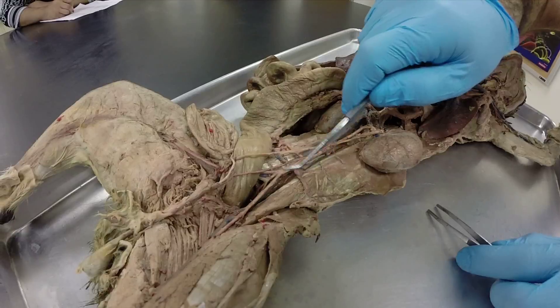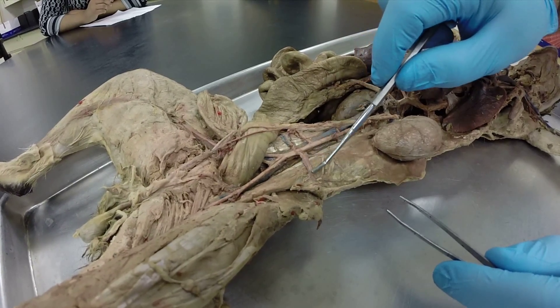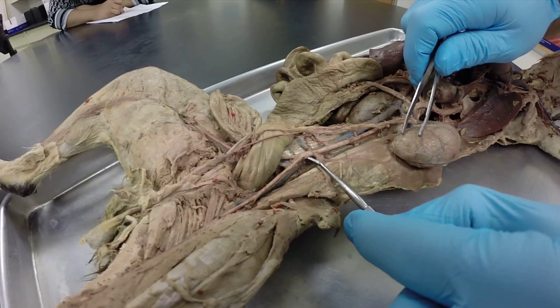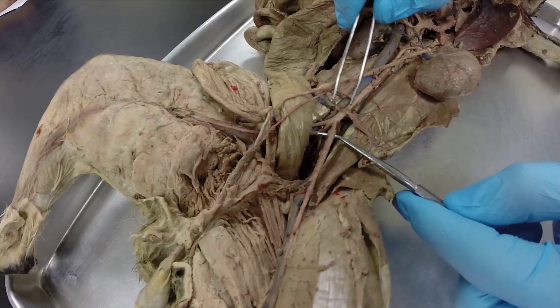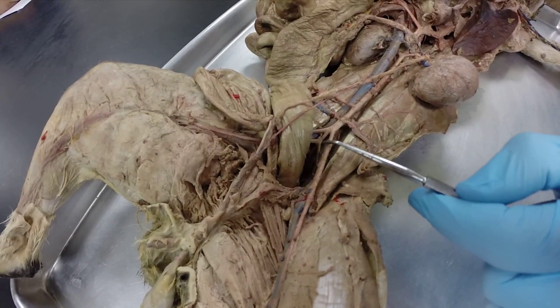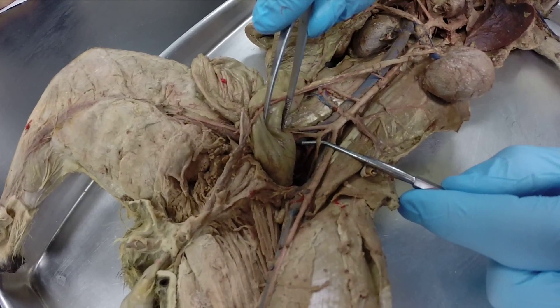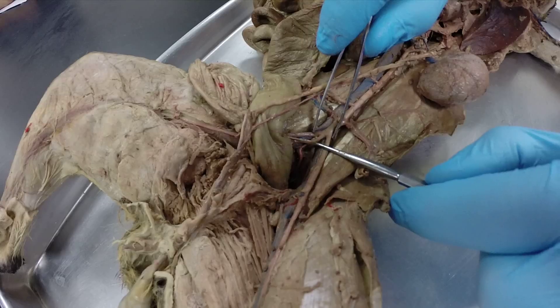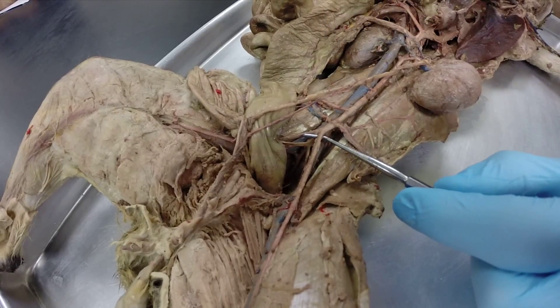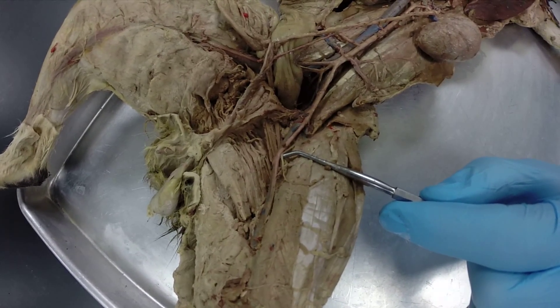Continuing down the descending abdominal aorta, the next branches are the ilio-lumbar arteries, left and right. Then the aorta branches near the leg area: the first branches are the external iliac arteries, left and right. We then branch a second time into the internal iliac arteries, left and right, and there is also a caudal artery continuing downward. The external iliac arteries continue out across the leg, at which point we call them the femoral arteries.